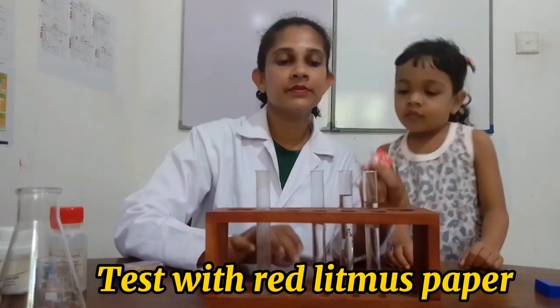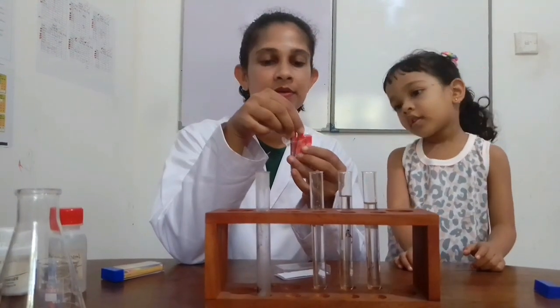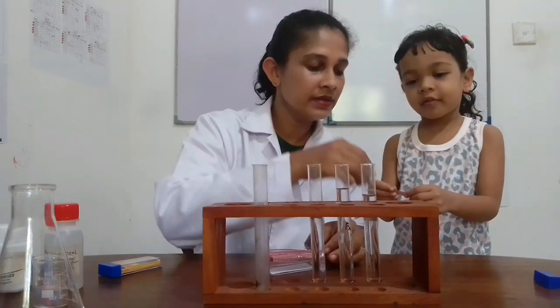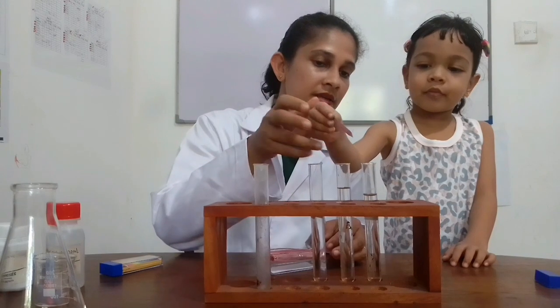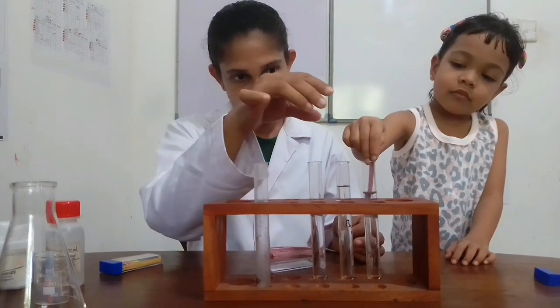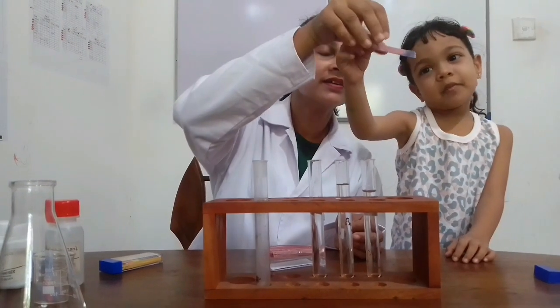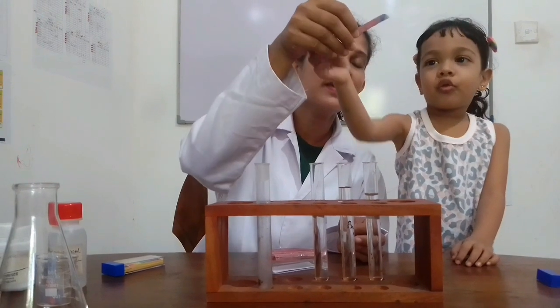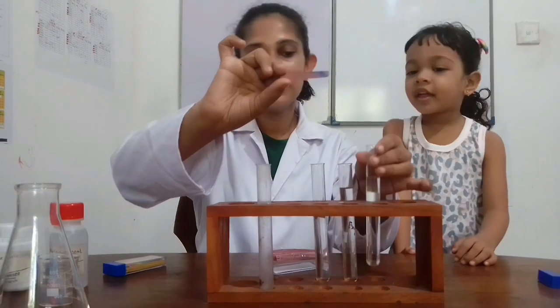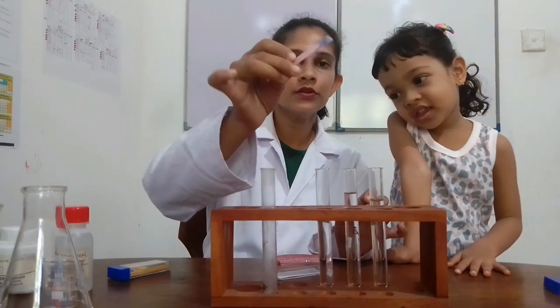Now I am going to test each of these solutions with red litmus paper. Let's see what happens when we dip this red litmus paper in sodium hydroxide solution. There is a color change. What color is that? Blue. The red litmus paper turns blue with sodium hydroxide solution.